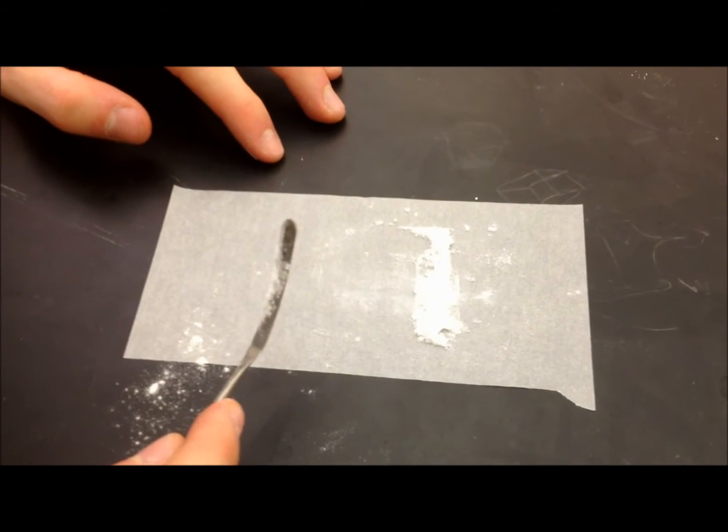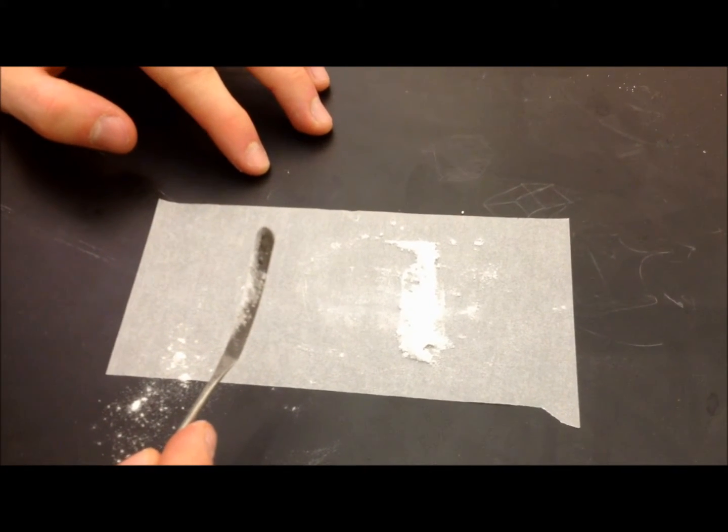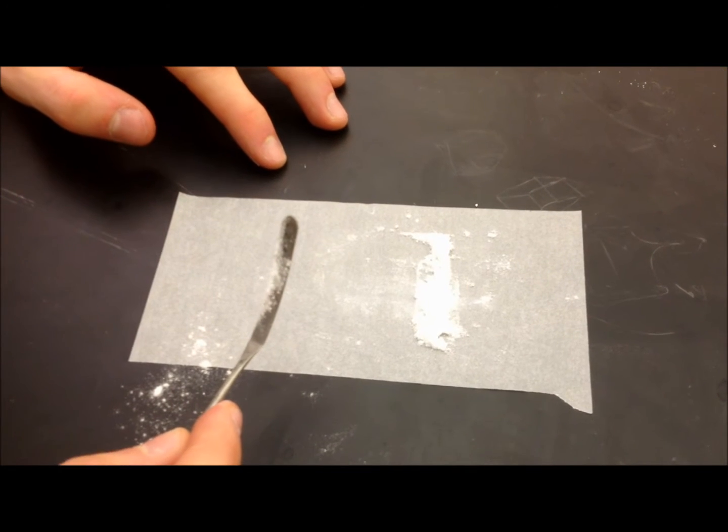In this procedure, we're talking about melting point. Melting point is used for the identification and or checking the purity of your compound.